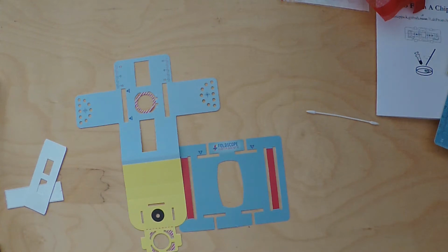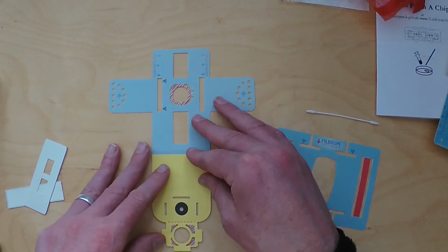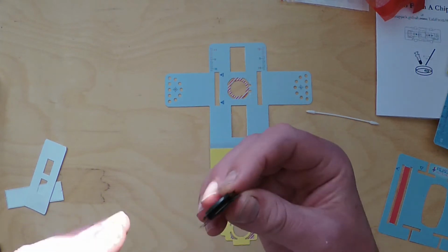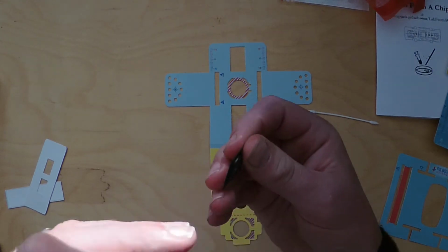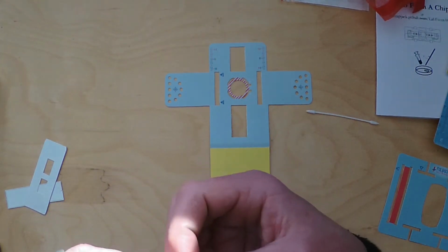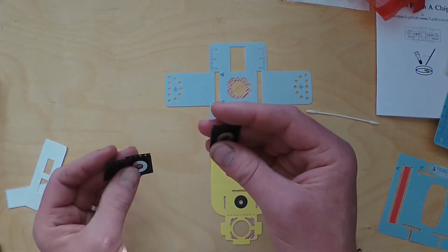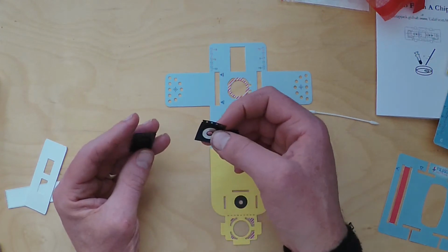Okay, so the first thing you need to do is find your little bag of lens couplers and your lens stage. So you open the bag up and you'll find three metal, bendy, flexible little grids. They've got this kind of perforated edge like film. It's a film strip, so when these lenses are manufactured at a large scale, I mean, the Foldscope say they've shipped well over 1 million of these microscopes worldwide.